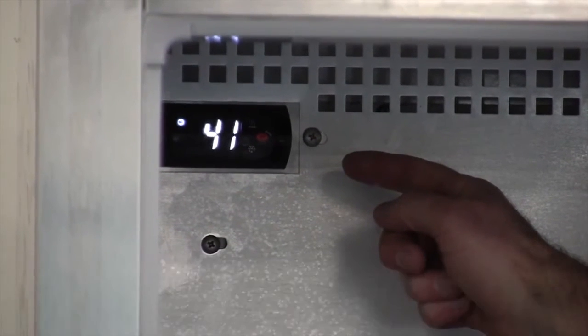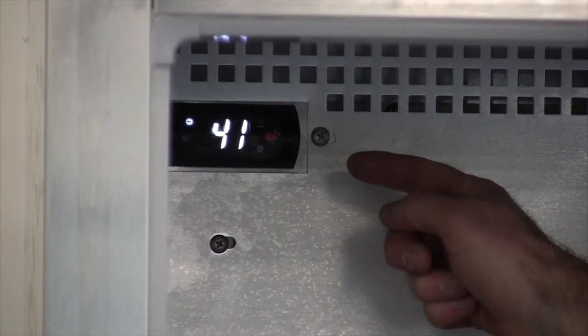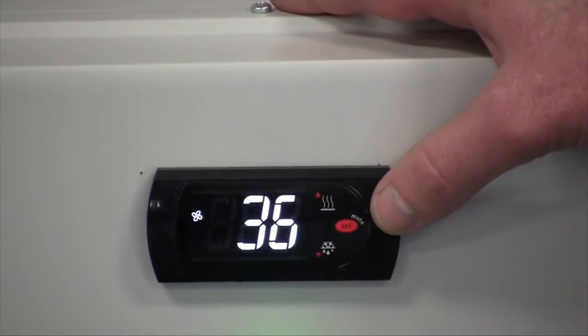Hello. In this segment, we are going to talk about changing the set point on Continental Refrigerator's electronic control.